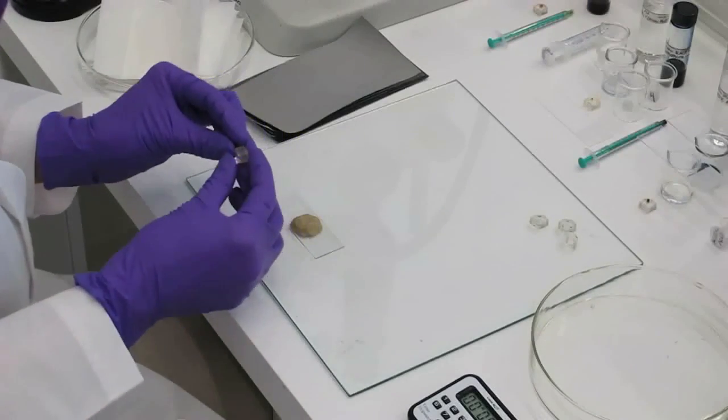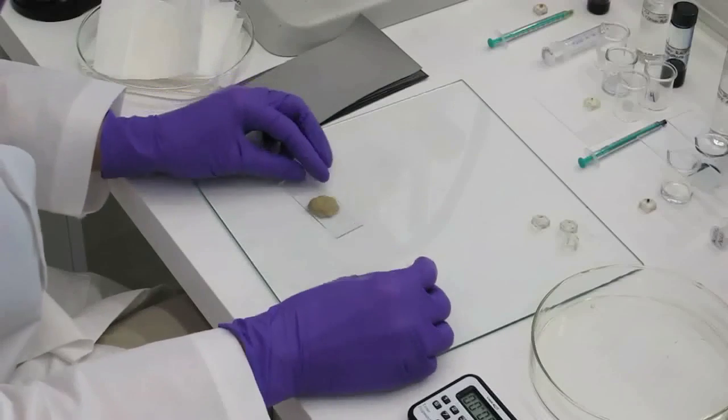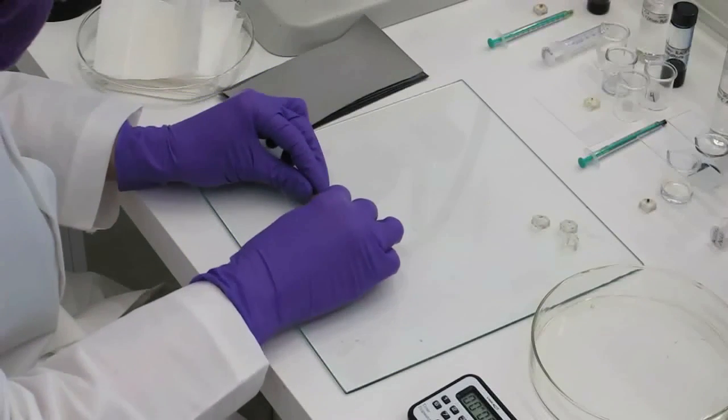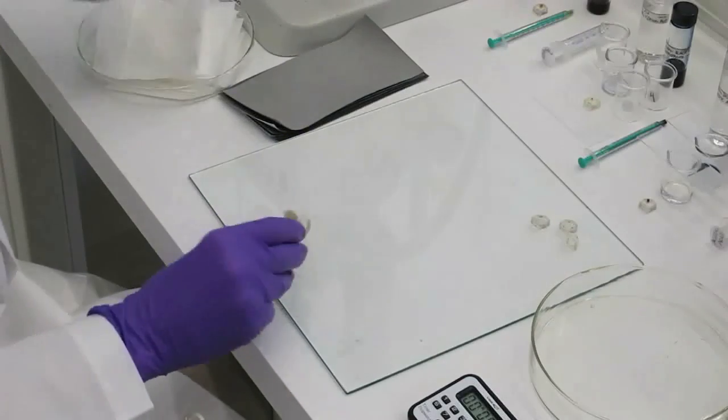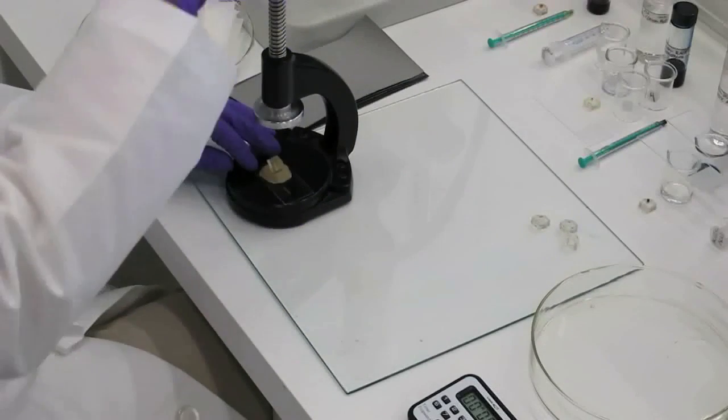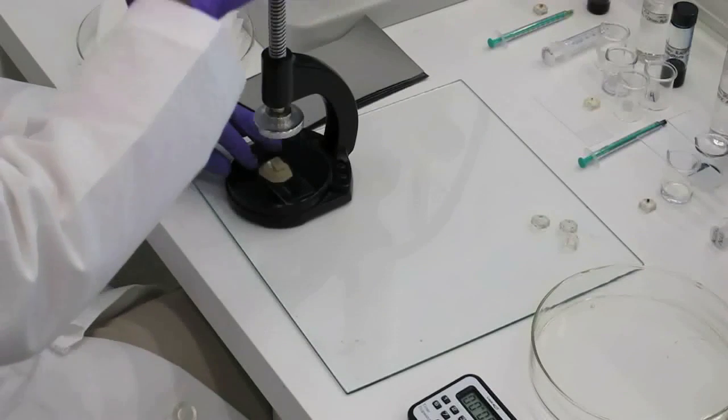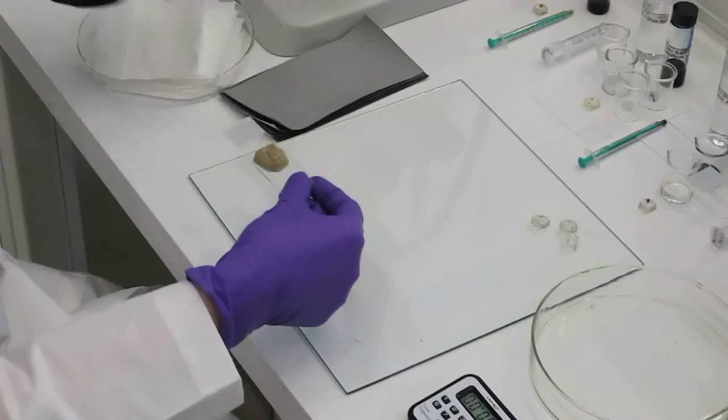After the polishing, the sample is mounted with plasticine on a glass slide to be examined under the microscope. The sample is adjusted so that its surface is precisely parallel to the slide. It is carefully wiped with a soft tissue to remove any surface dust and then it is placed under the microscope.